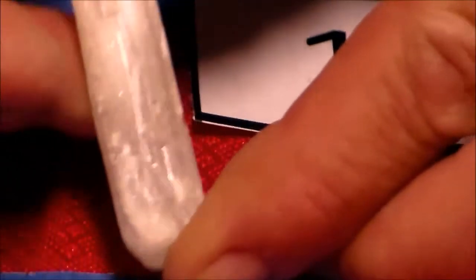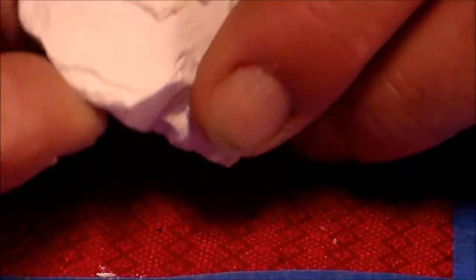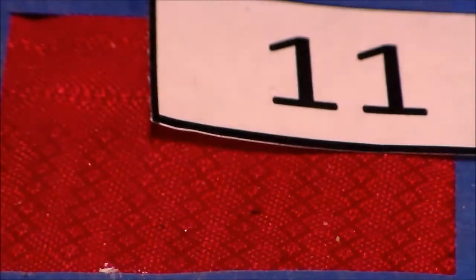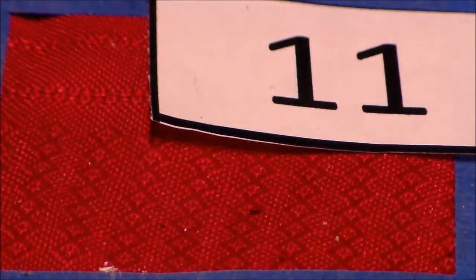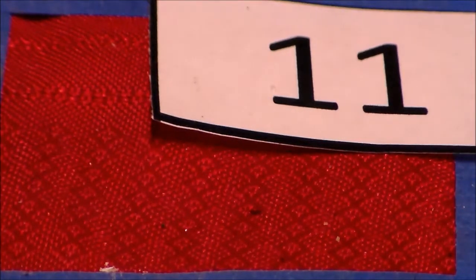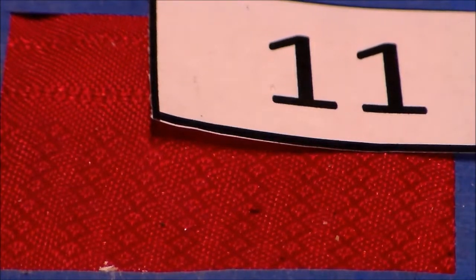It easily scratches that one. And it pretty easily scratches that one. So we've got 3 of them now. So now we got to look at some other properties. Well, we know we've got a hardness of 2 because it's been given to us.